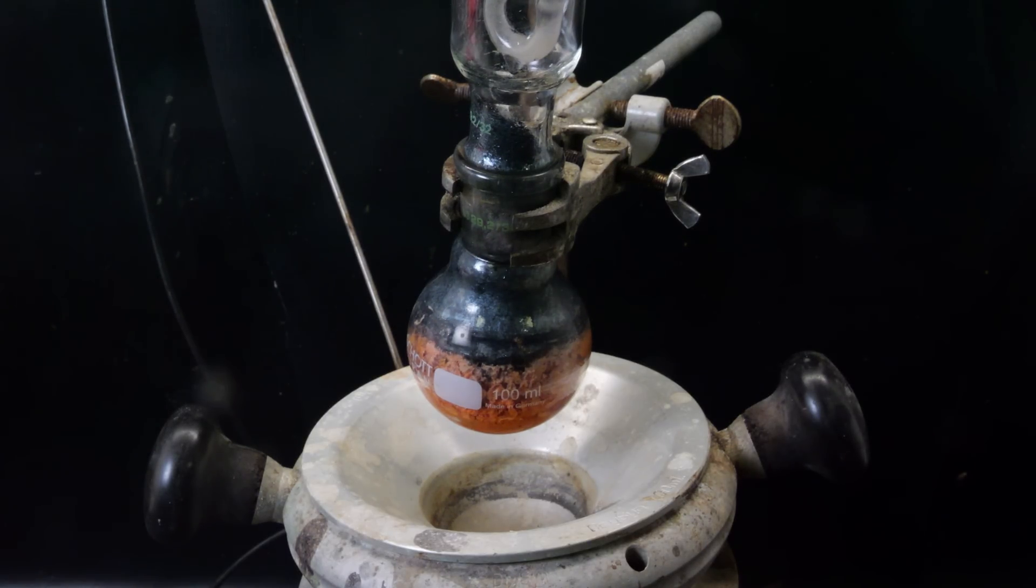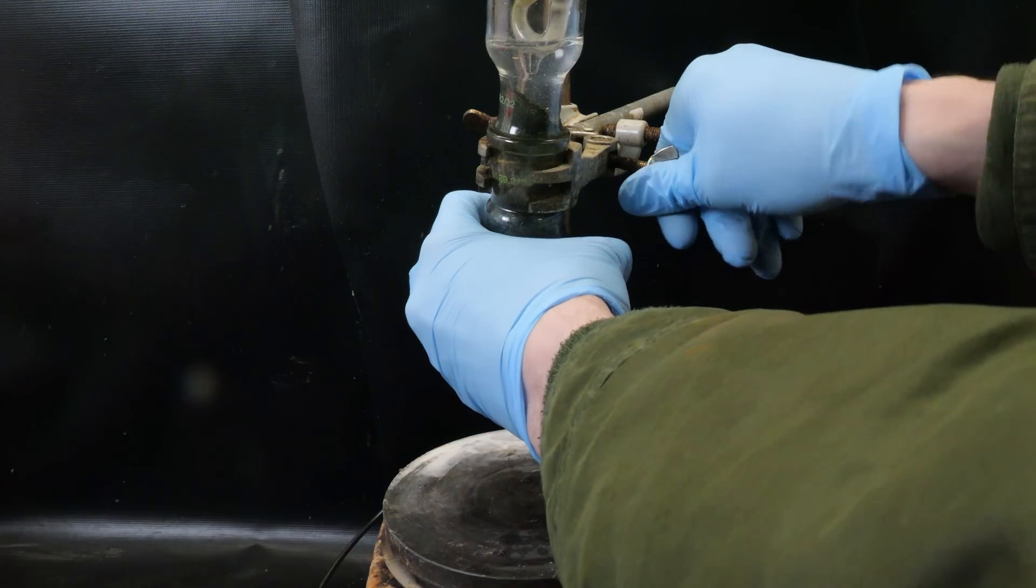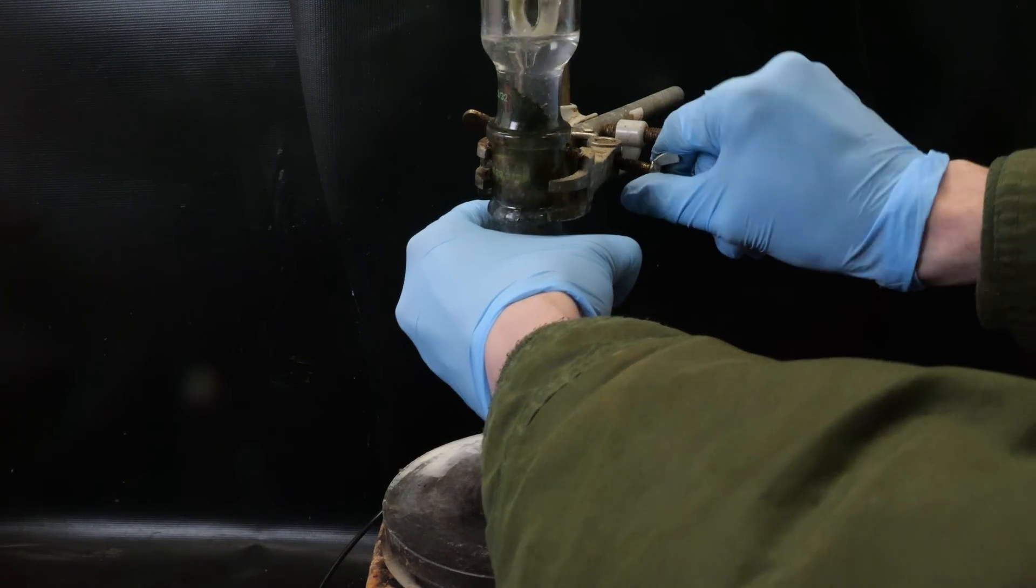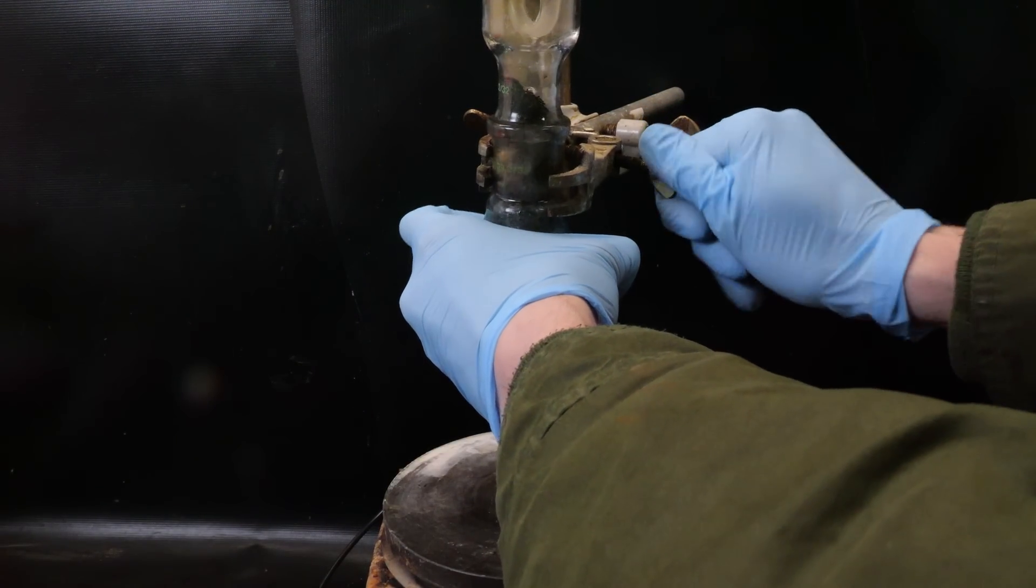I allowed it to cool down to room temperature. And then to destroy any remaining sulfur trioxide and dilute the sulfuric acid, I add some water through the condenser. The reaction produces heat, but overall it was quite tame.